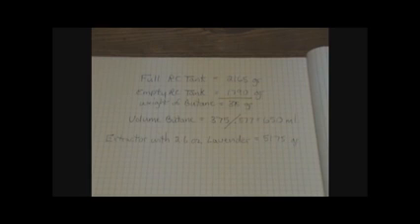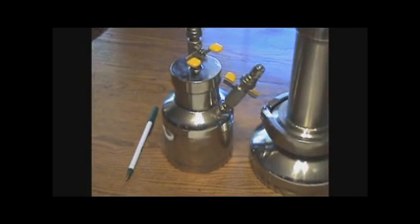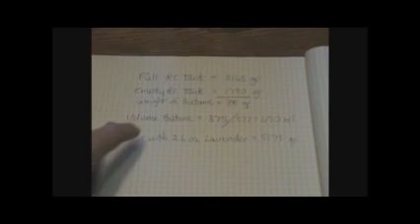I like to take notes on my weights and volumes, and everybody should do that if they want to be safe. We have a full tank filled with butane. The amount of butane brought the weight up to 2165 from an empty weight of 1790, so 1790 from 2165 equals 375 grams — that's the amount of butane by gram weight. To convert to volume, divide 375 by 0.577, which equals 650 milliliters of butane in this tank.